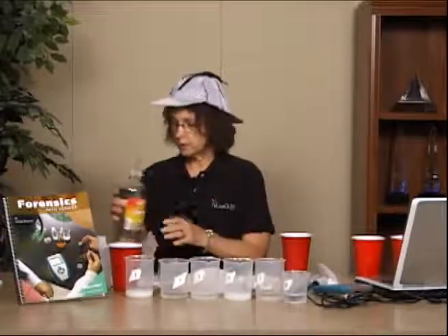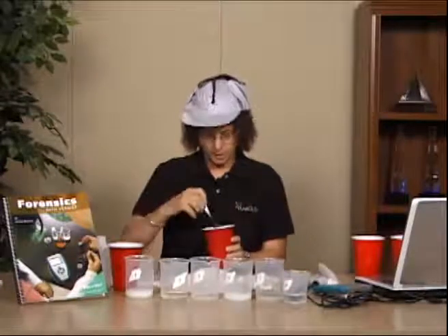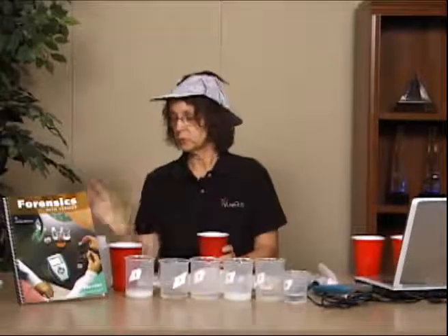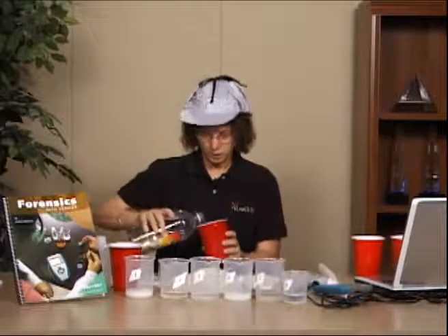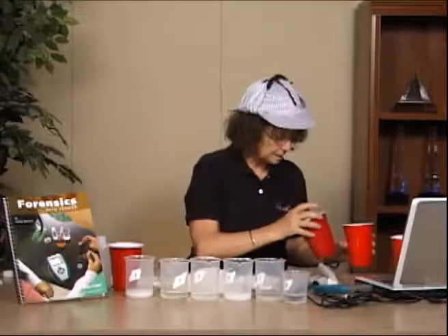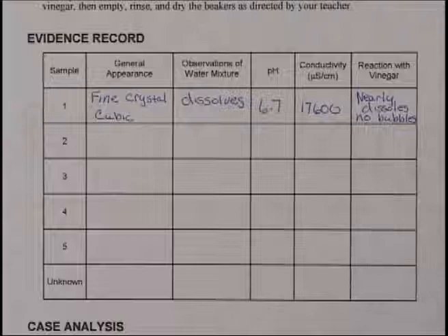And so all we're going to do now is take each of the samples and put them in a cup. You want it in a cup because the vinegar will bubble violently in some of these cases, and you don't want vinegar all over your table. So I tend to use big cups a lot. And just pour a little bit of vinegar in. If you want, you could use a pipette and see what happens. And again, the students have log sheets, and they're recording those notes in those log sheets. And they're telling me how much it reacts or doesn't react.